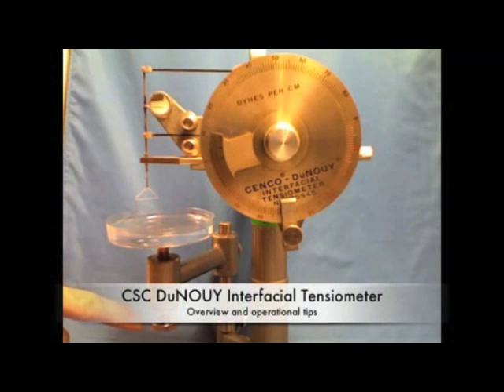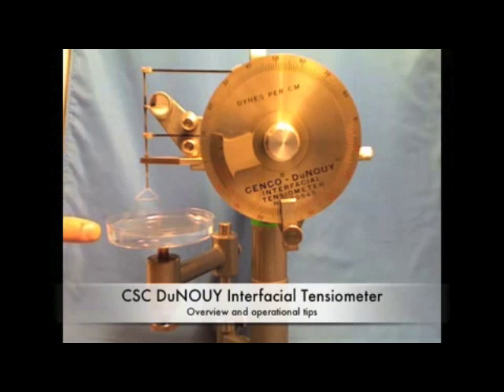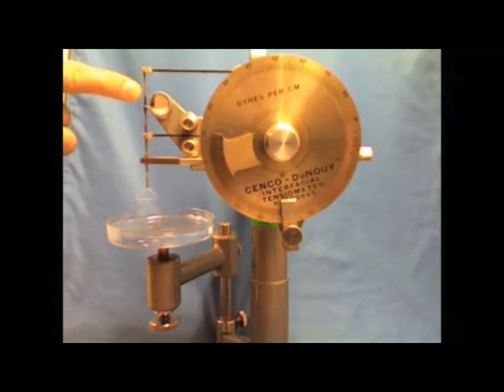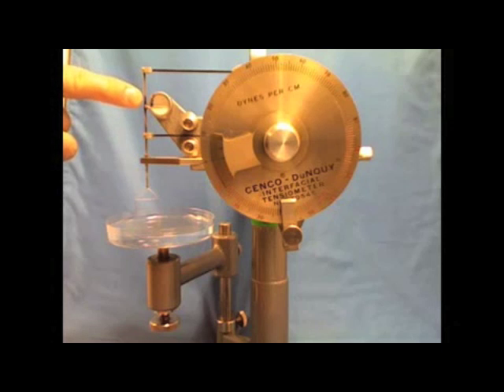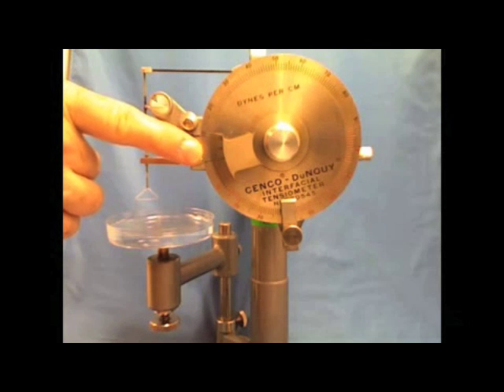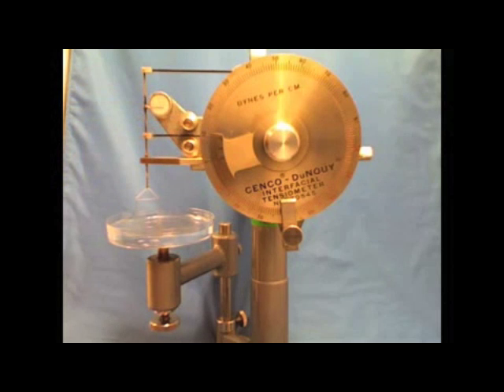Important features of the DuNOUY tensiometer include the screw for lowering the platform, the petri dish for the sample, the DuNOUY ring, the mirror for leveling, and the dial for reading off the dynes per centimeter and the dial for adjusting the dynes per centimeter.